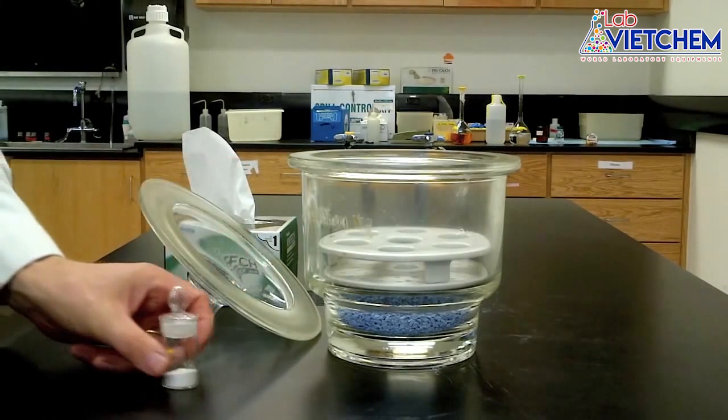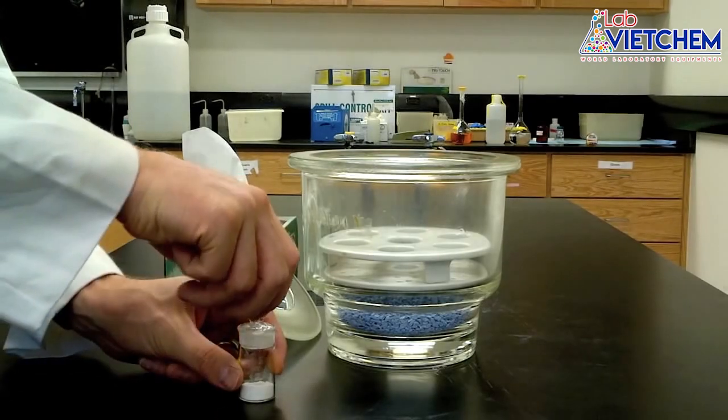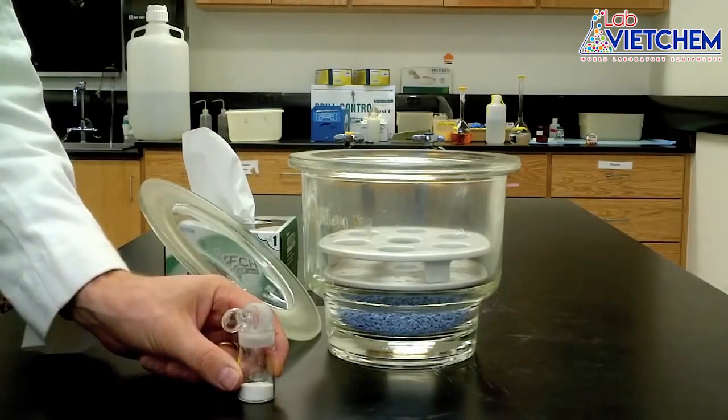Now let's deal with the sample. It's completely useless for your sample to be in the desiccator if it's sealed shut, okay? So prop open the lid before placing it inside.